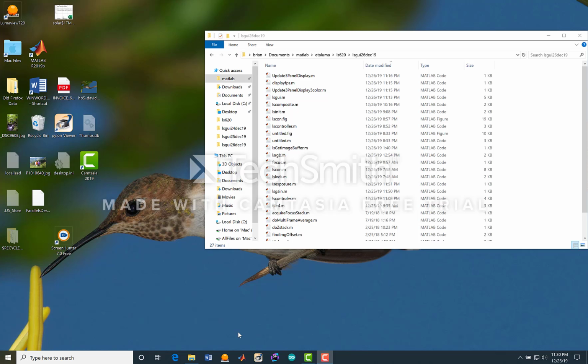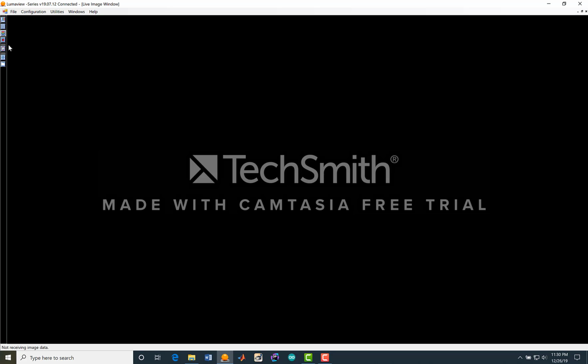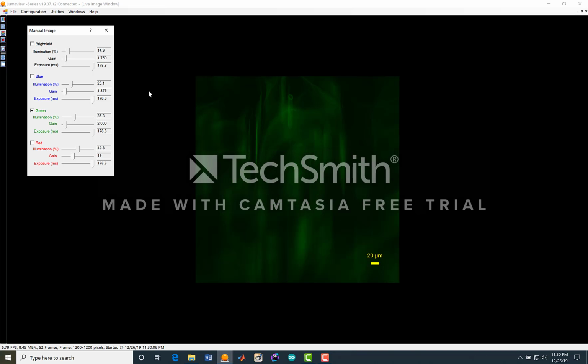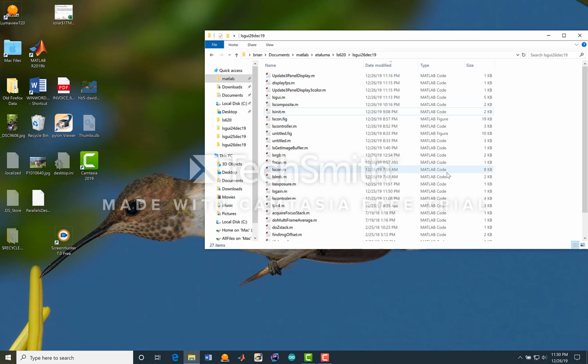I'm doing a bit more work on the GUI for Matlab's interface to the lumascope. It's night time, so here we have an image. Looks good, and we can pan around. So we will close LumaView, and then we'll open up Matlab.